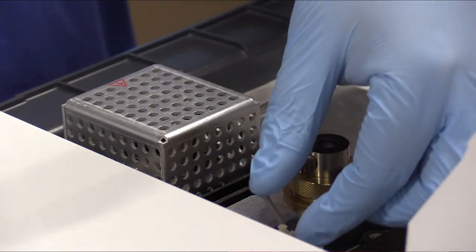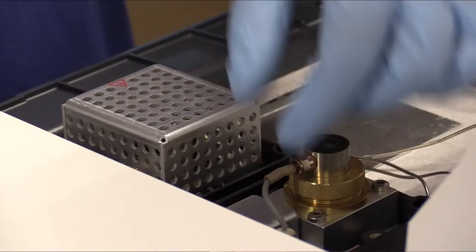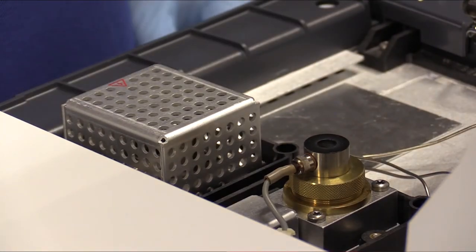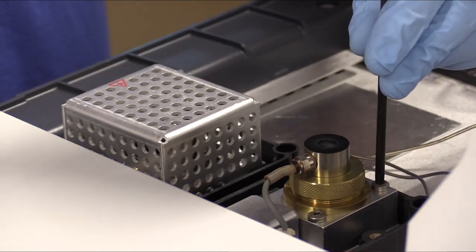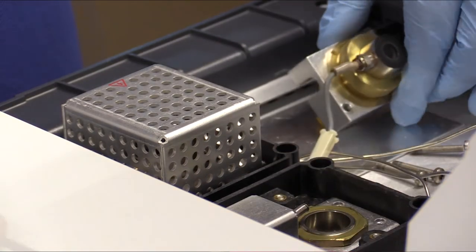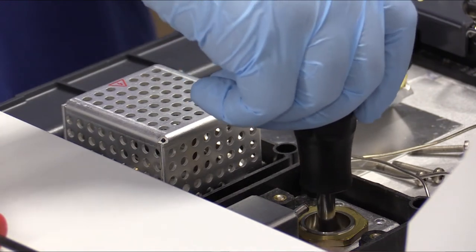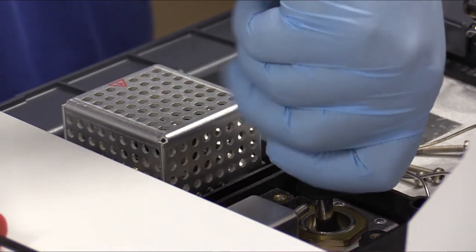The first of those is disconnecting our igniter cable. And once we've done that, we can then remove the screws that attach the FID assembly to the instrument itself. We can remove that whole assembly as one part, and that reveals to us the FID jet. We'll grab a nut driver, and that we'll use to remove the jet itself.